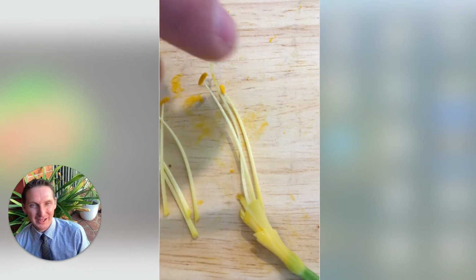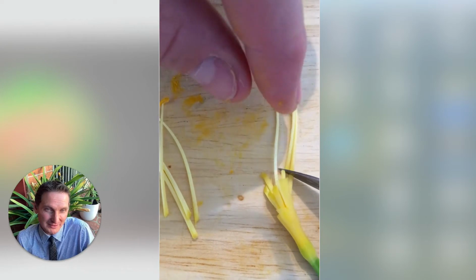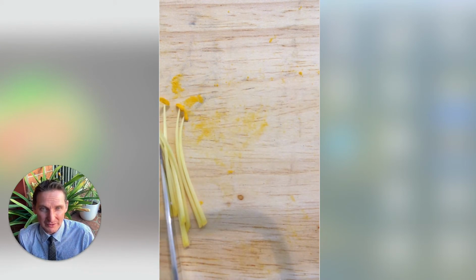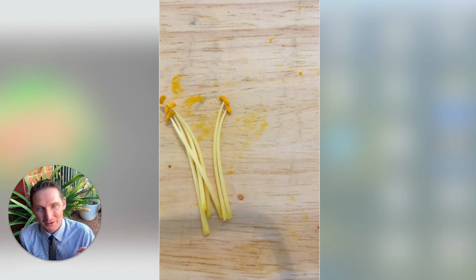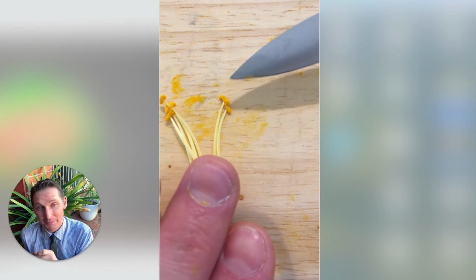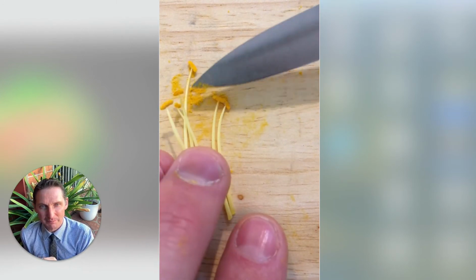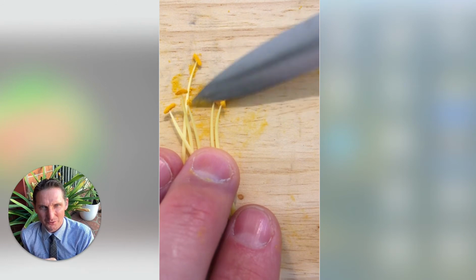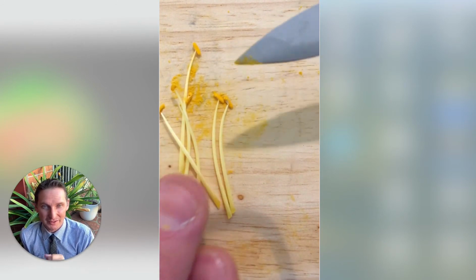So you can see the pollen coming off, which is the male gamete. It's like male sperm, but it's pollen grains. All right, so that's the male part of the plant. Now the pollen is all over that yellow anther. There's so much pollen per anther. So now I've dissected off the male parts of the plant, and I'm just taking off as much as I can. You can tell there's so much pollen on each filament, on each anther.